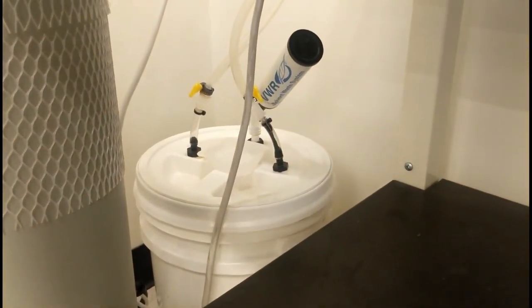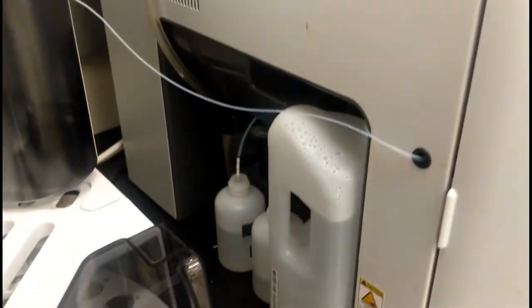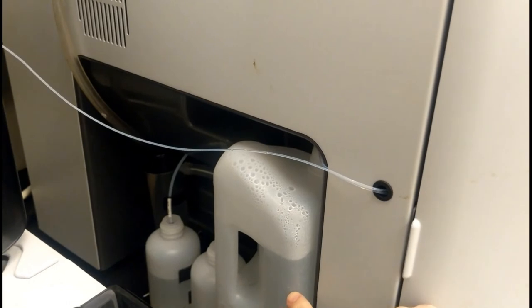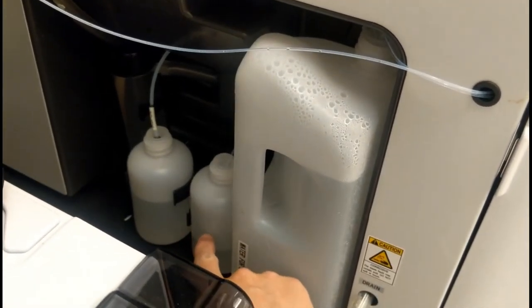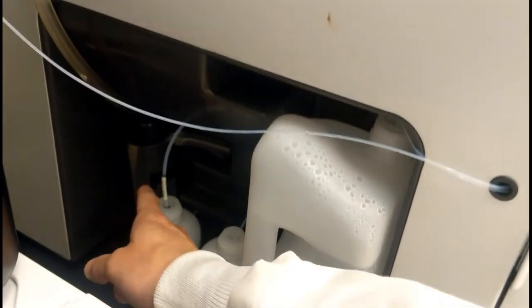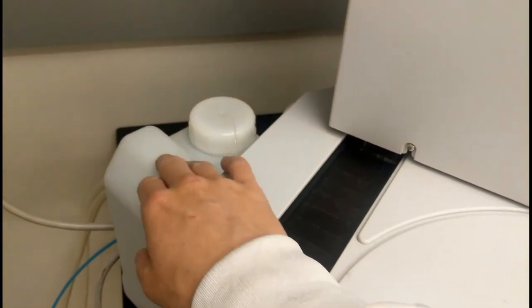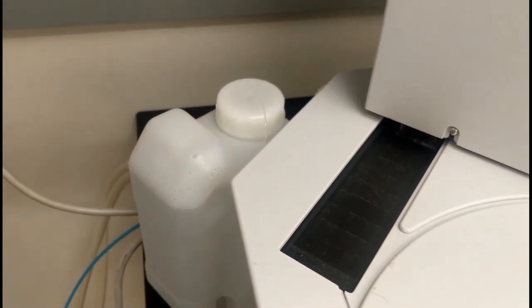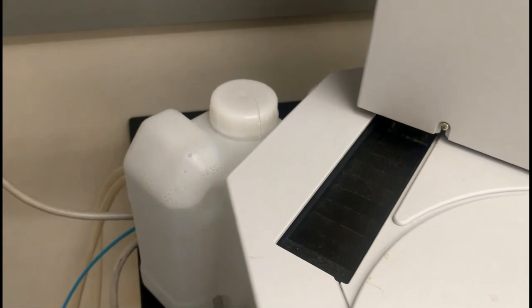If those both look good, we're free to check some other things around the instrument. Check the waste container in the back — make sure it's not completely full, because if it is, you need to empty it. Coming around to the side of the instrument, the biggest bottle is your diluent bottle, which should be filled with acidified water. Next to that is the hydrochloric acid bottle, which should be filled with 2 molar hydrochloric acid. Next is your IC reagent bottle, which should be filled with phosphoric acid. Behind that is your drain pot — make sure it's filled with water. Finally, on the other side of the auto sampler, there's a bottle that should also be filled with acidified DI water — this is your vial zero, so anytime you have a vial zero in your sample run, it'll be drawing from that bottle.